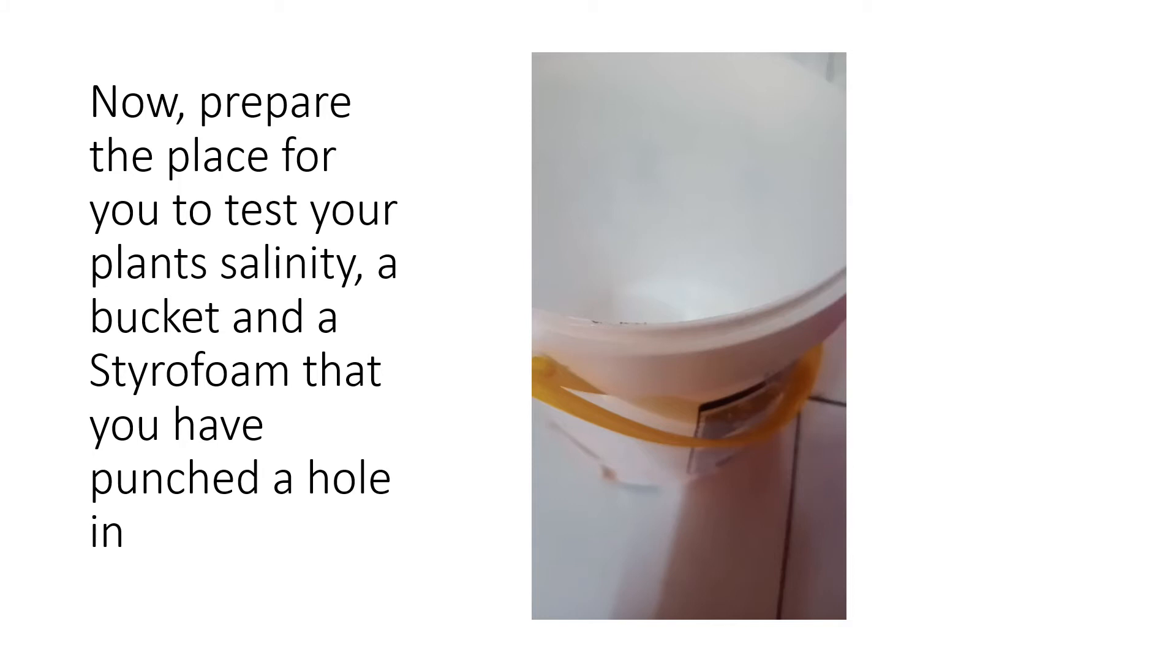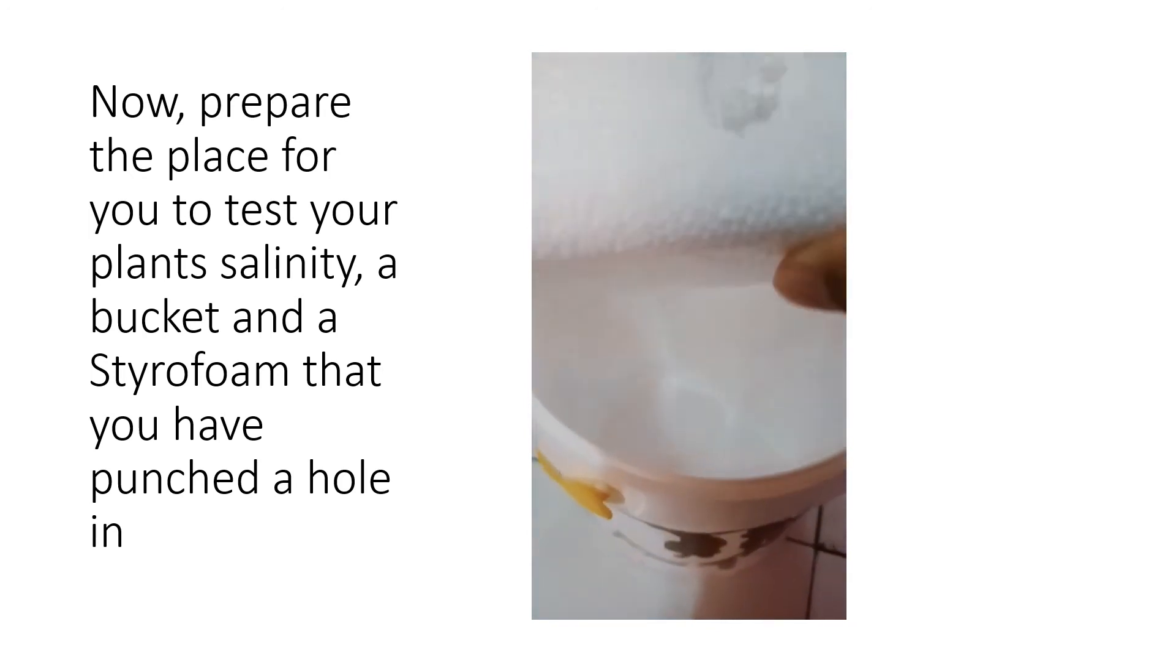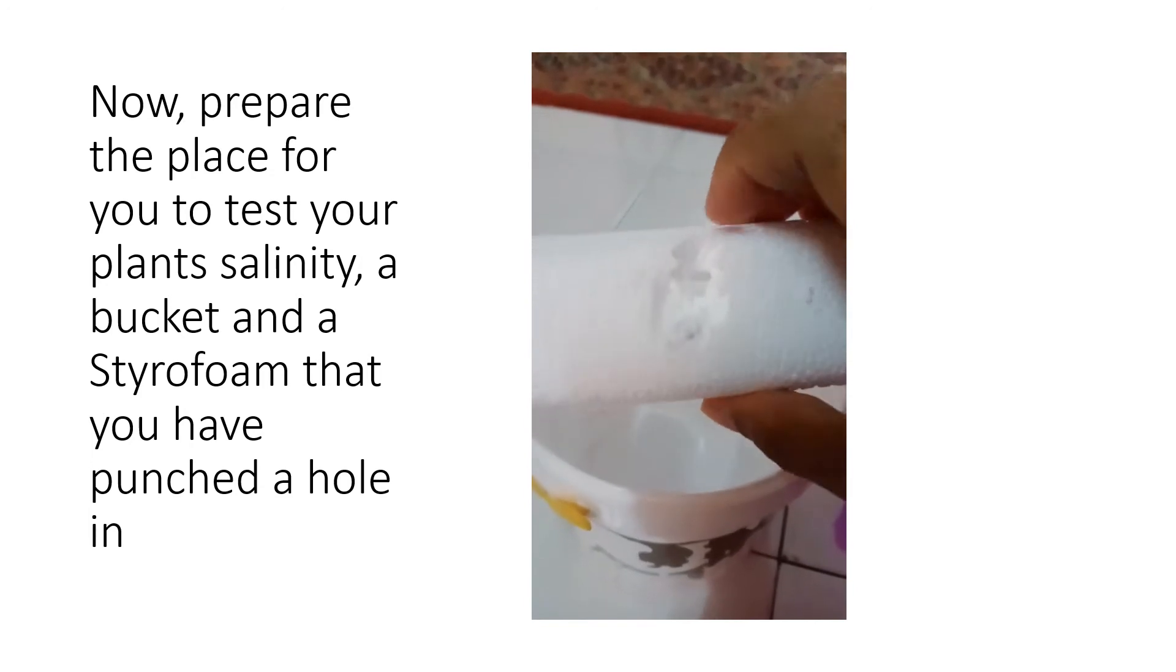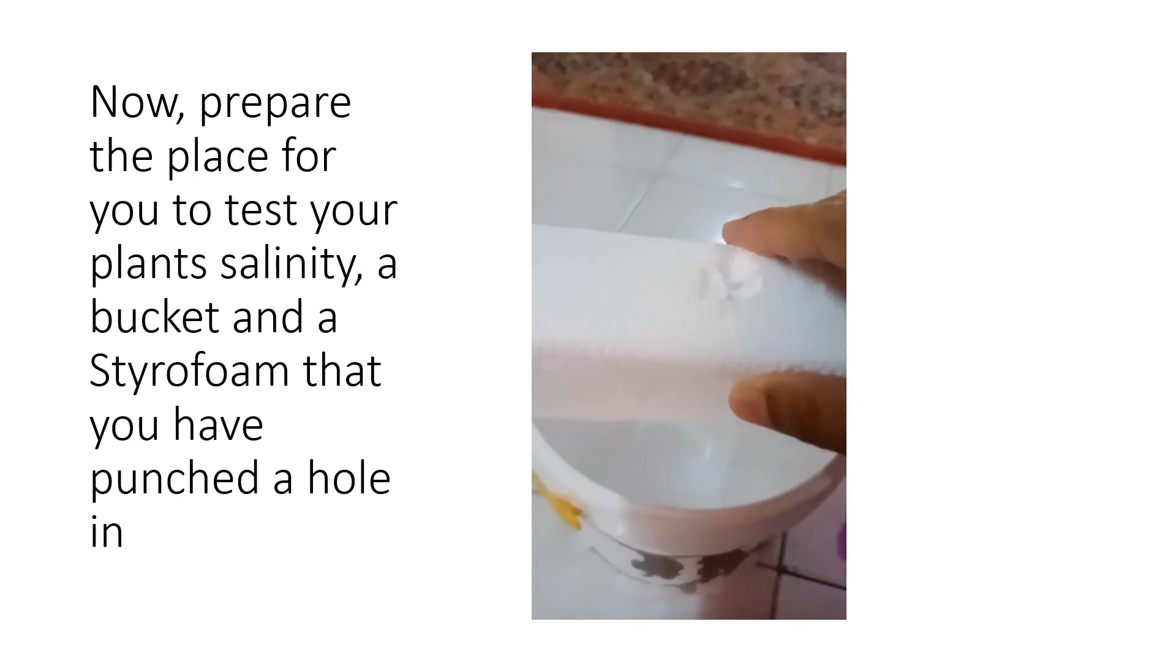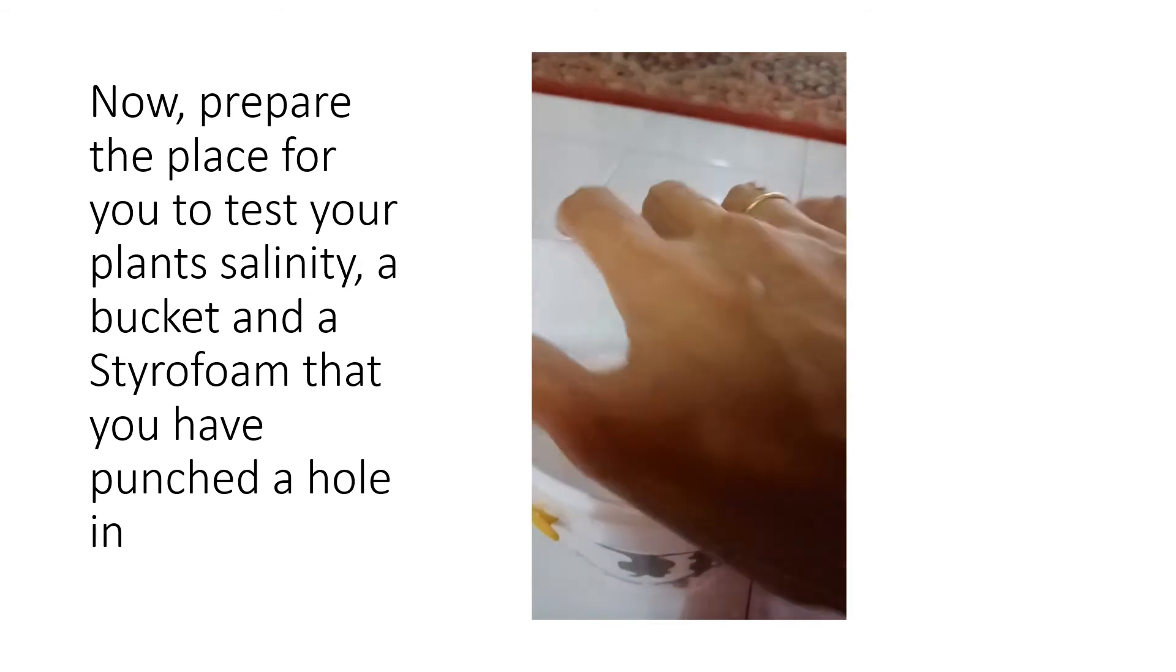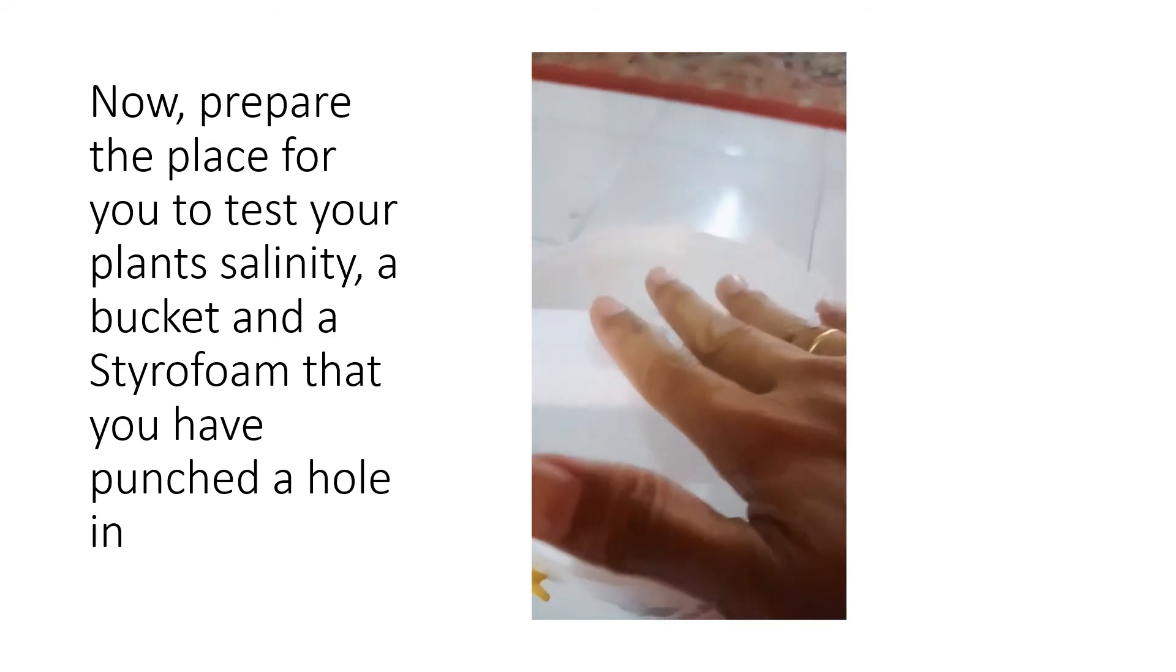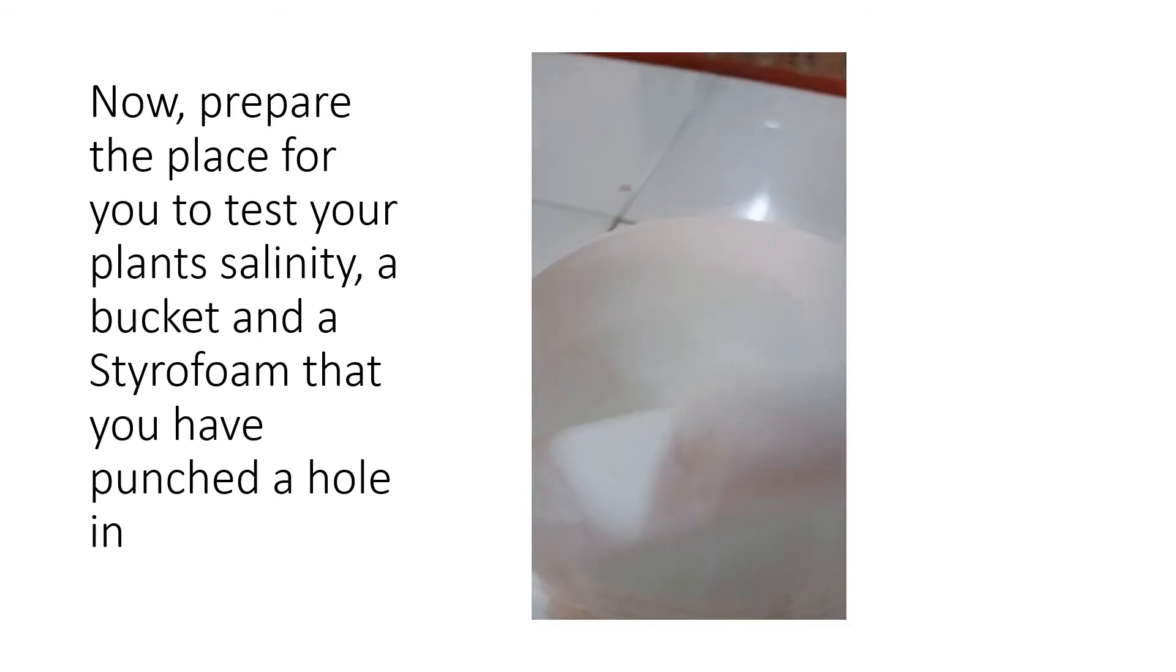Next, prepare the setup to test your plant's salinity. I have a bucket which I no longer use. I'm going to put this foam which I have already made a hole in. This hole is basically for you to put in your plants later on because we're going to test for salinity. Push that in carefully.